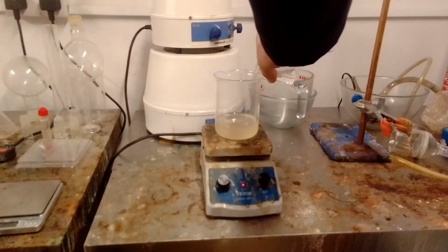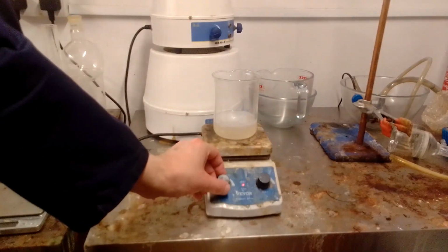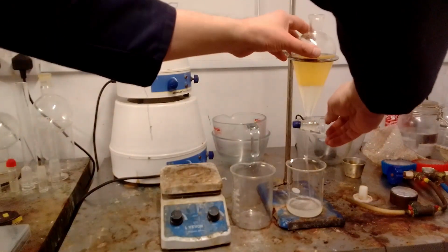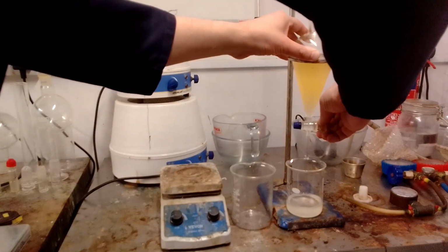Hydrochloric acid was added to the mixture, neutralising any unreacted sodium borohydride and turning the mixture from yellow to colourless. It also caused some gentle effervescence, which subsided after 15 minutes. The metabisulfite solution was then added to the mixture, causing it to turn from colourless to yellow, and stirred for 30 minutes. The organic and aqueous phases were separated.